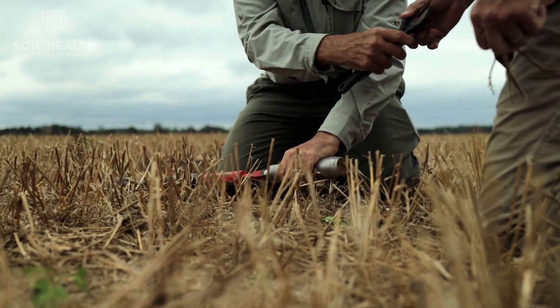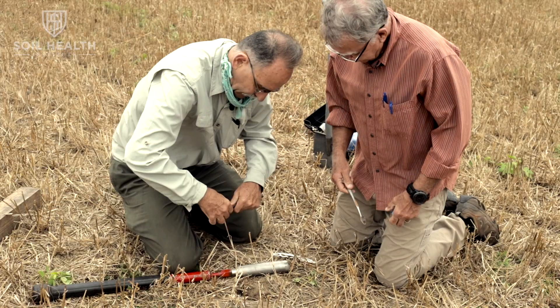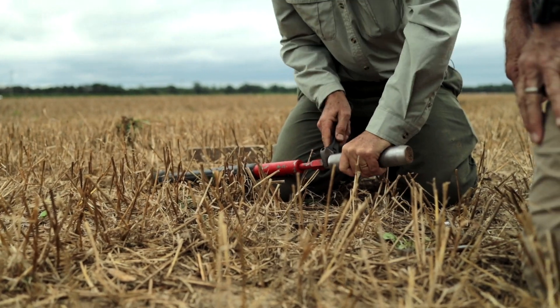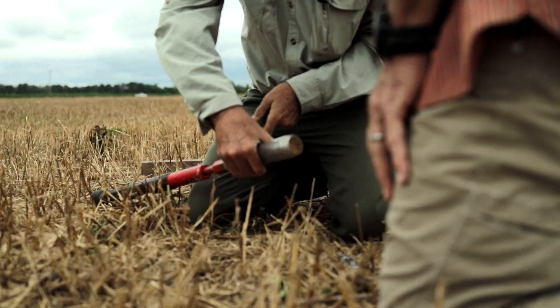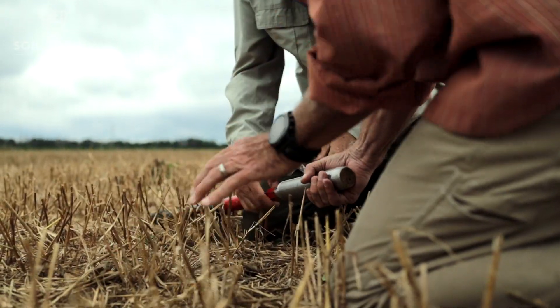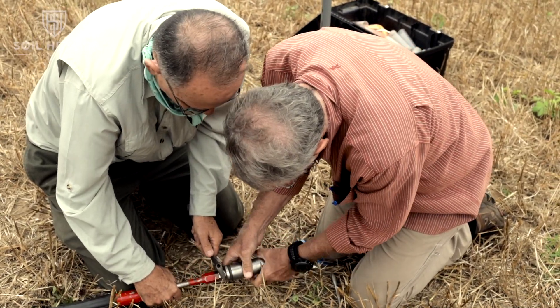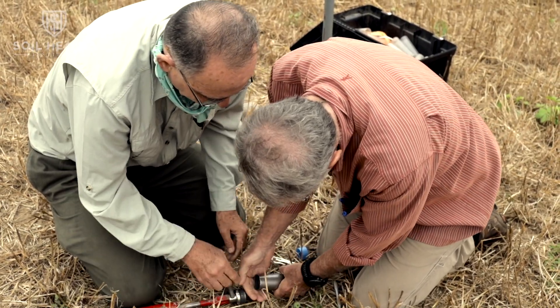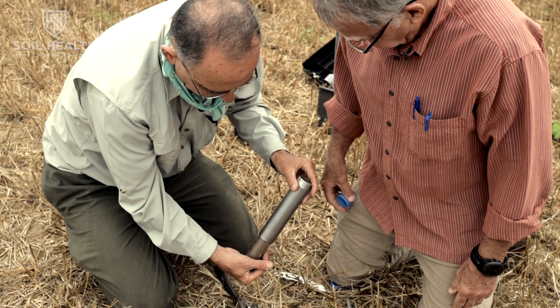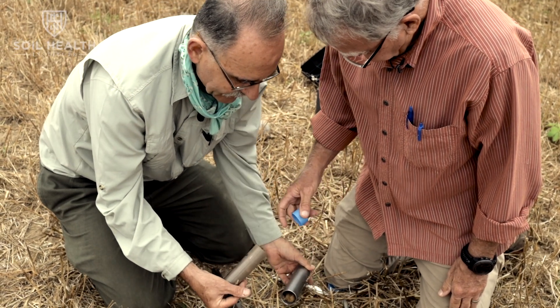This is where it can be tricky — you've got your toothbrush for your best tool. Can you see if you can turn that, David? There we go, perfect. Let's have a look — you've got this almost perfect soil sample here.